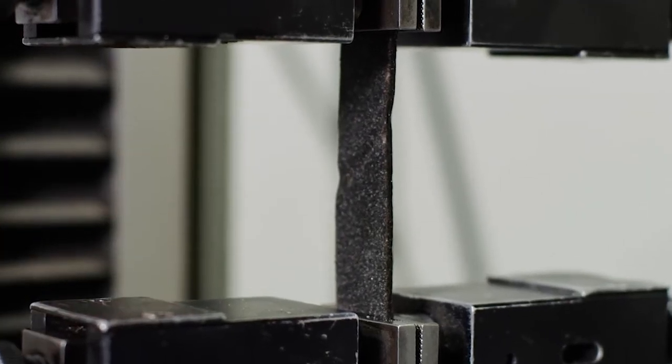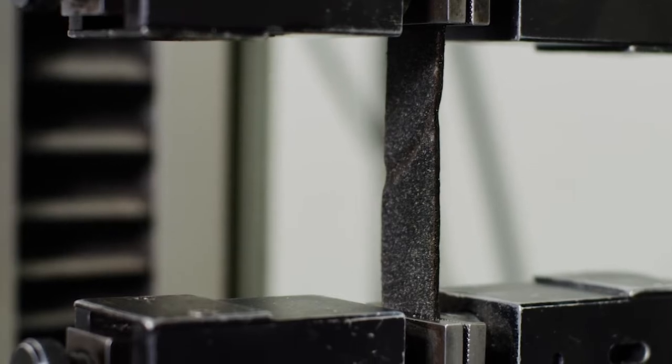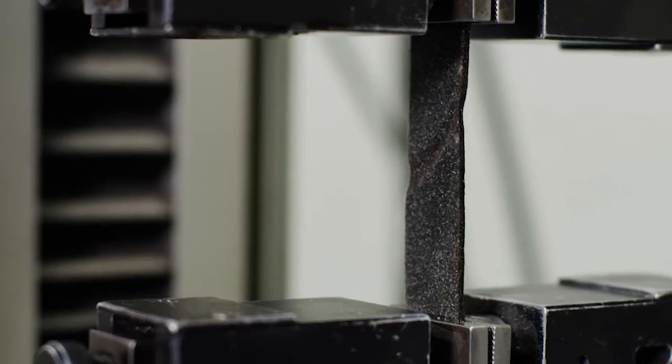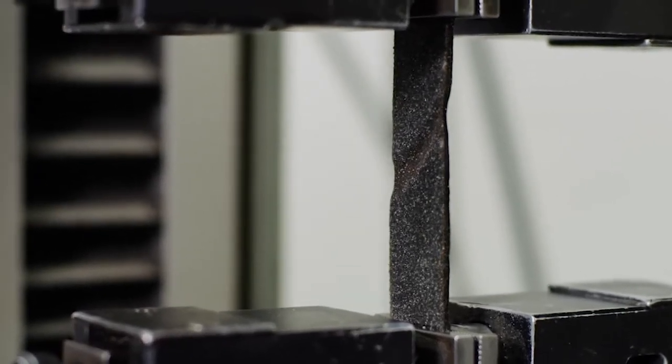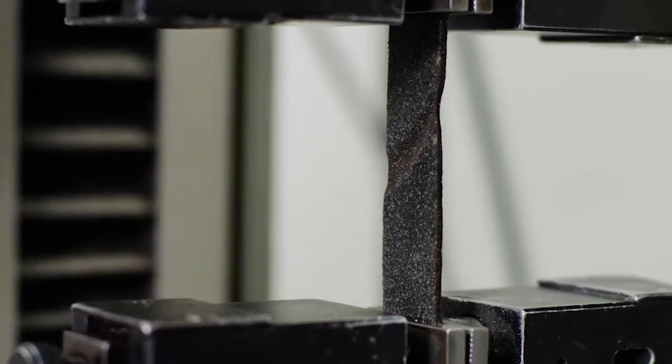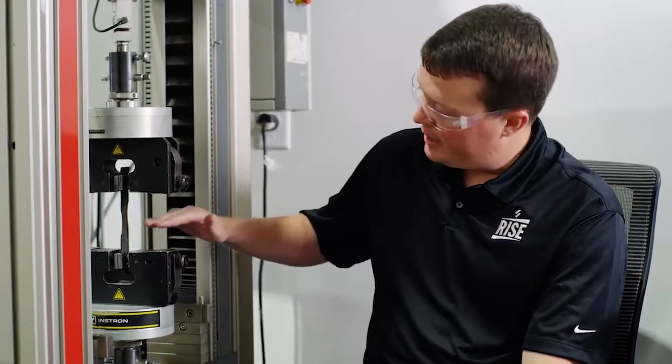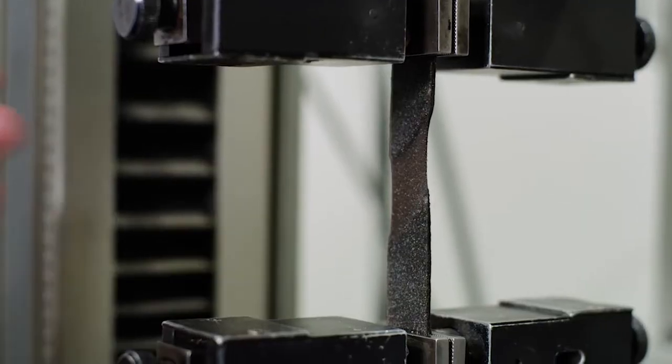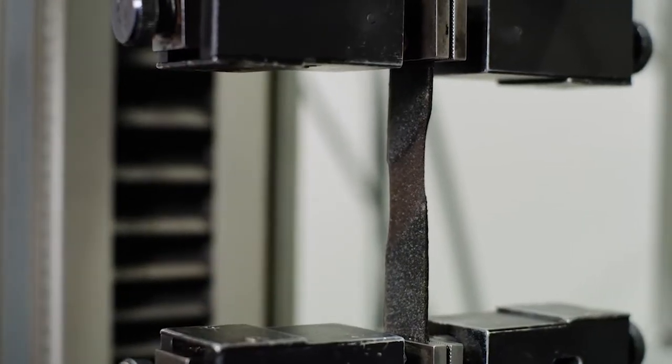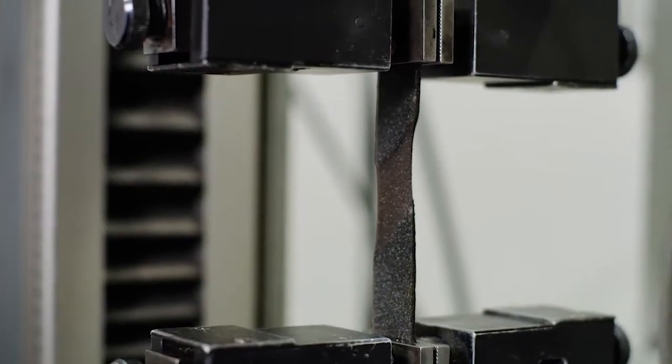The reinforcement's been broken, so this is all elongation of the blend that you're seeing. You can see that nice amber color of the blend and that's showing the elongation of the blend itself and not the fiberglass anymore.